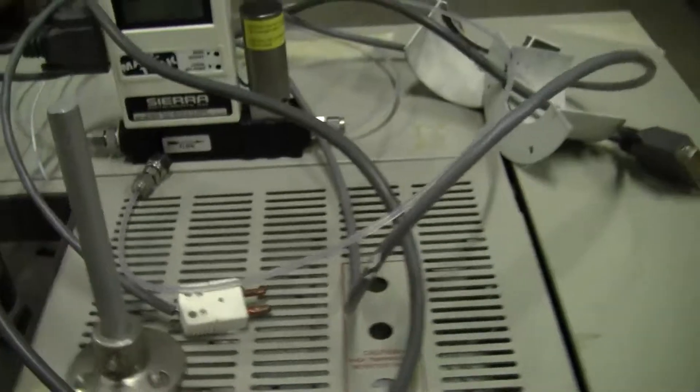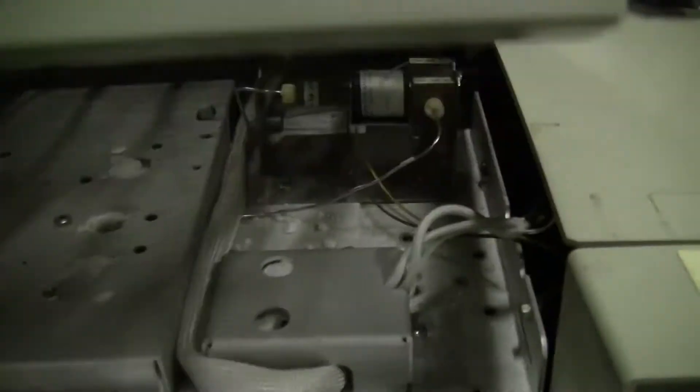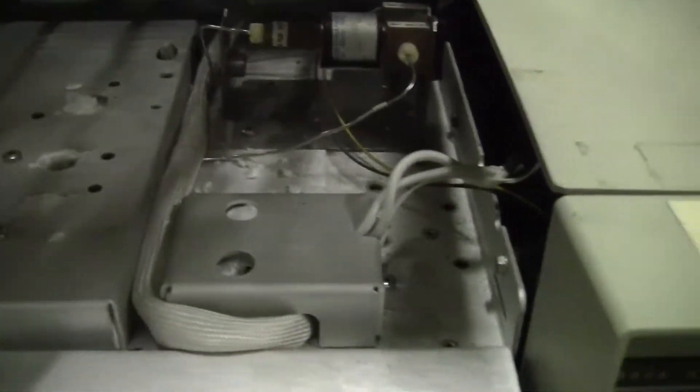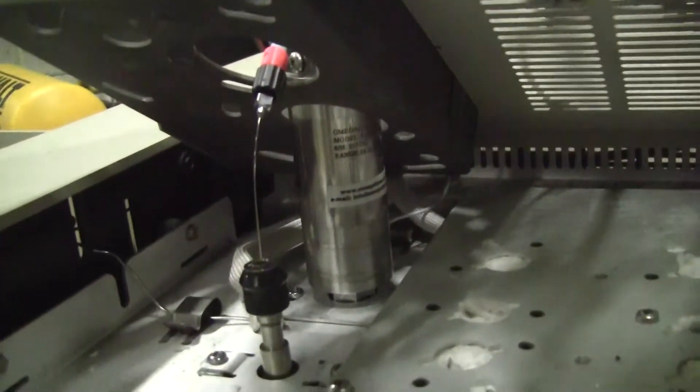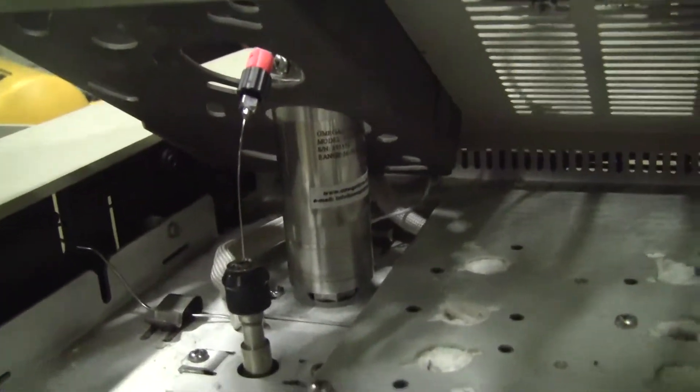All right, under the hood a little bit. Valving and such. Open the inside.